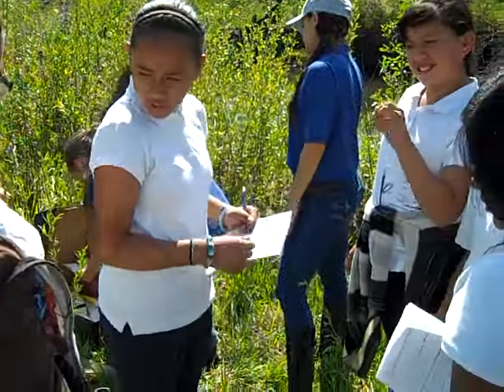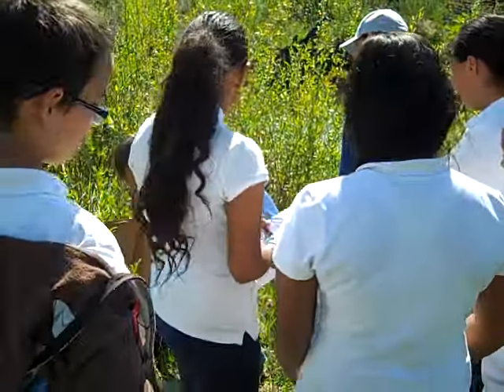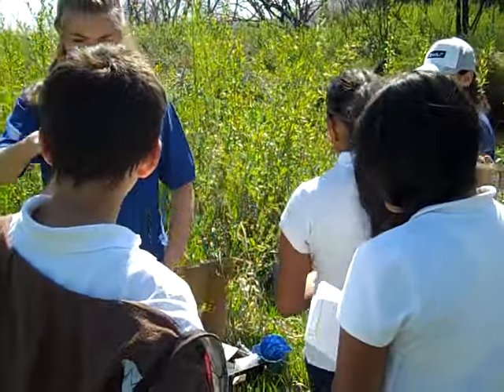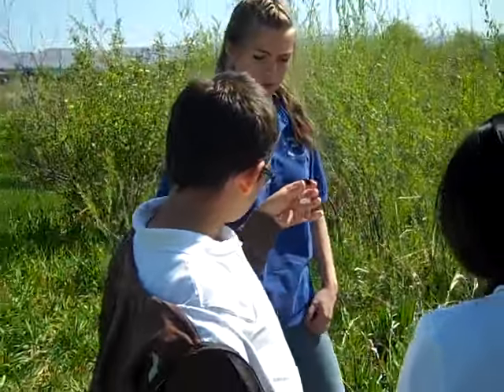Shake it. I think, okay, stop shaking that one. So I'll just leave it. And then that one, this one is going to take a while. It's going to take a couple of days for that one to get the results.